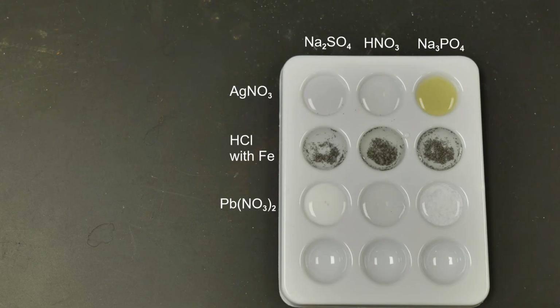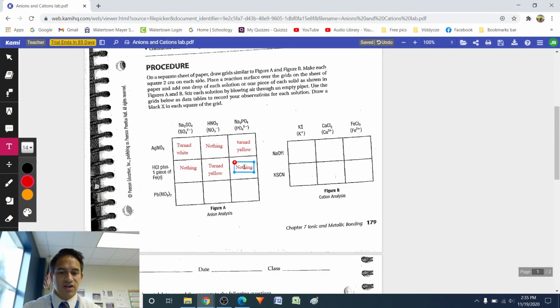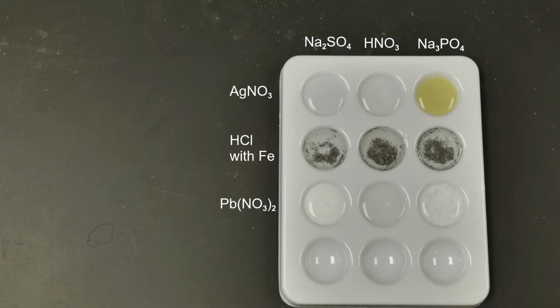So the HCl and the iron is really only good at identifying the nitrate ion, and it was not very good at identifying the other two. And then lastly, with the PbNO3, the first one I'm pretty sure turned white. We'll have to look back at the footage, but I believe this one turned white. The middle one did nothing, so the lead 2 nitrate was not good at identifying the nitrate ion in the nitric acid.